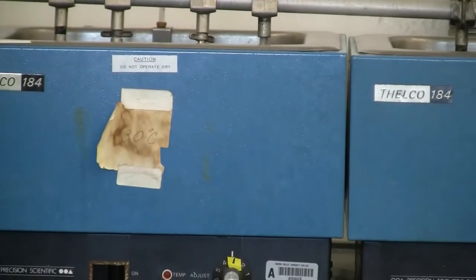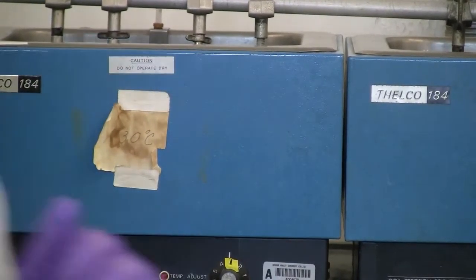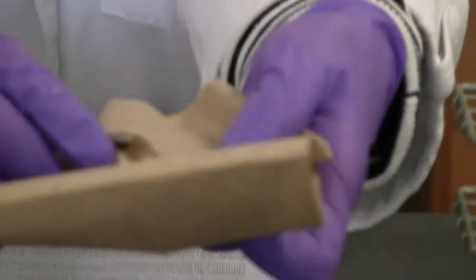See that? Originally, we saw a lot of bubbles on the surface. Now, the surface is no longer shining. Let's get rid of the liquid. Let's get the solid piece out and observe the surface of the zinc. Put a paper towel. Okay, now, on the paper towel, you can take a close look at the surface. Notice the color and the appearance, compared to the original shining zinc metal. You can see the difference.